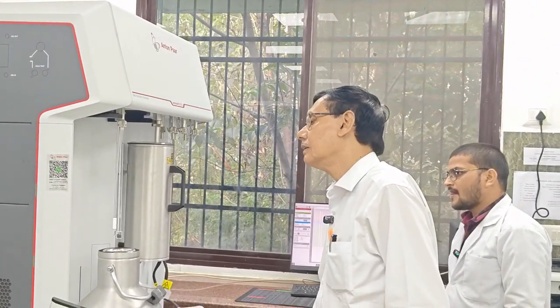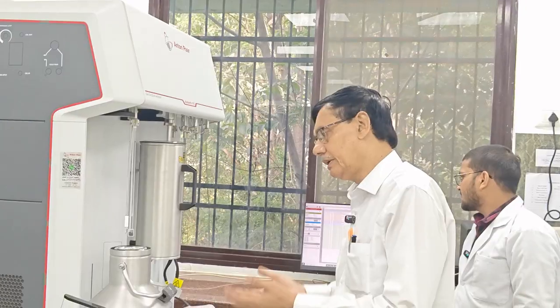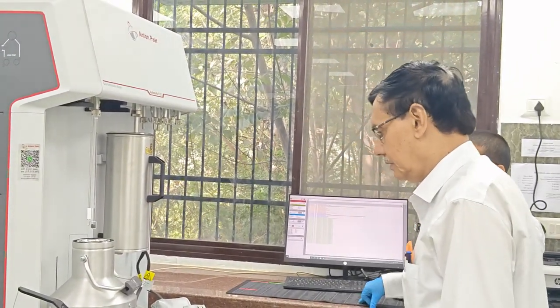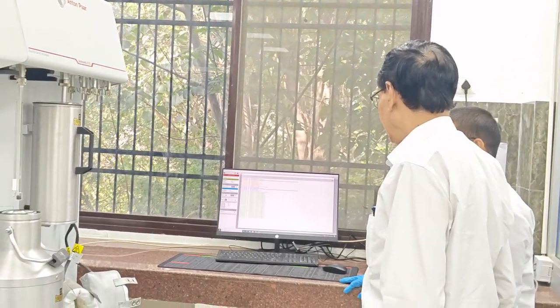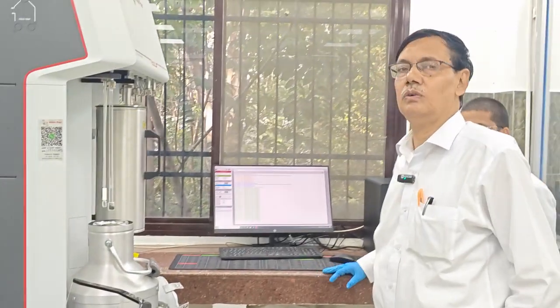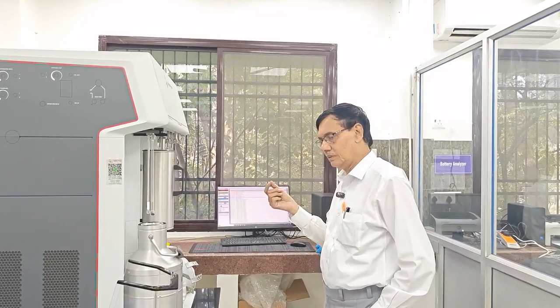It will maintain everything, temperature, everything, and automatically it will increase. So you know that it is a very lengthy experiment, because we are gradually using that nitrogen gas.